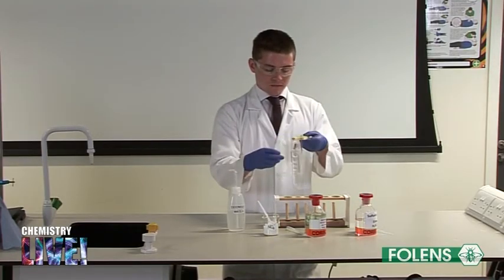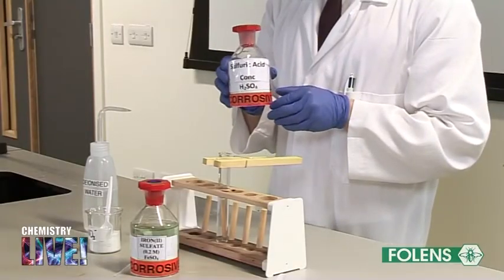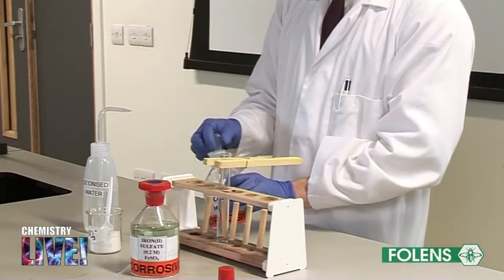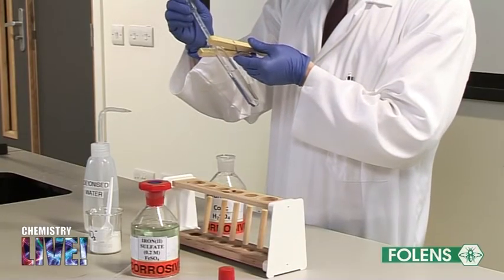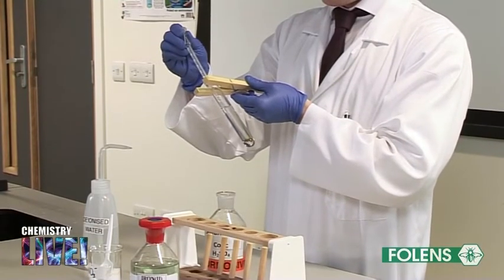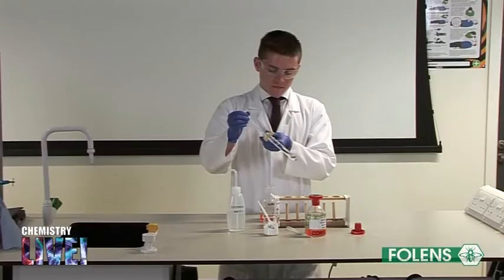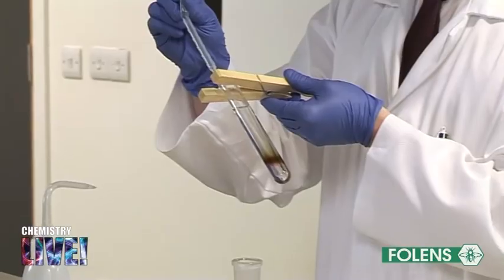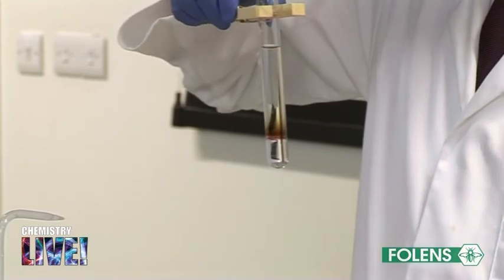This step involves the use of concentrated sulphuric acid. Extreme care must be taken with this substance as it is highly corrosive. Using a dropper, pour about 3 cm³ of concentrated sulphuric acid down the inside of the test tube. The test tube should be slanted as shown. Since the concentrated sulphuric acid is so dense, it settles to the bottom of the test tube and forms a layer beneath the mixture. Note that a brown ring is formed at the junction of the two layers.